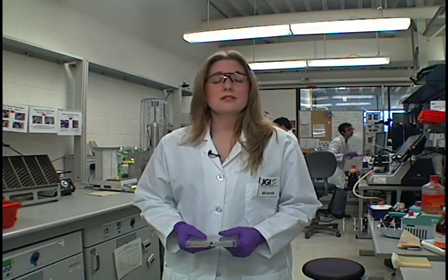Here we are on day three of the process. So far, we've collected the DNA, fragmented it into three kilobase segments, inserted those segments into the plasmids, and inserted the plasmids into the E. coli bacteria.